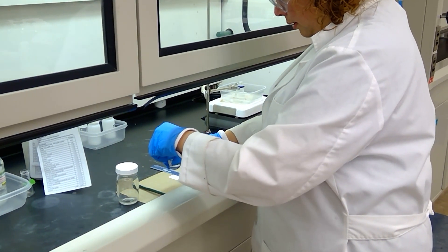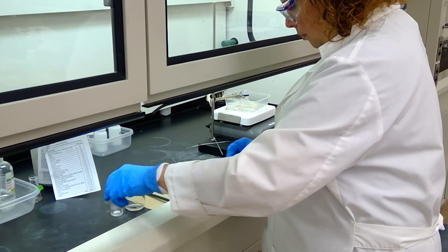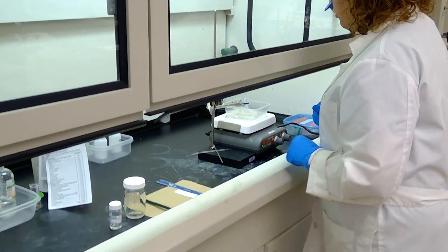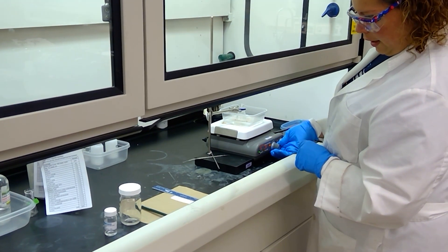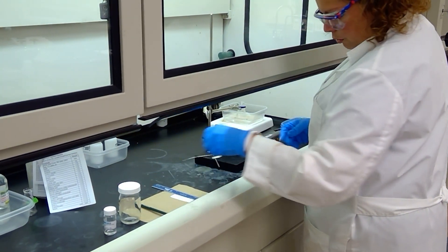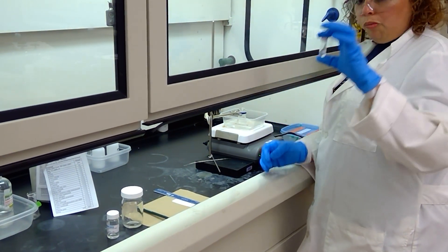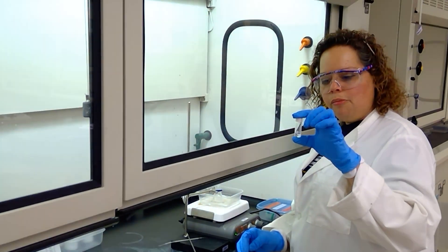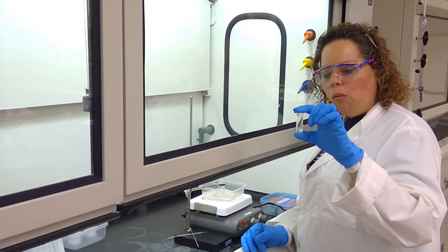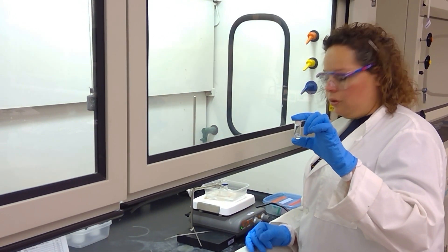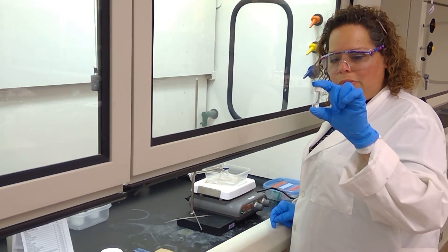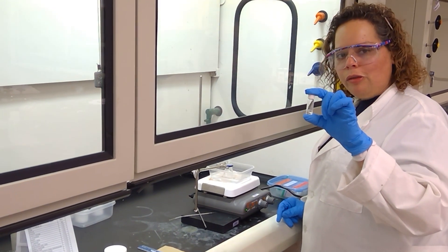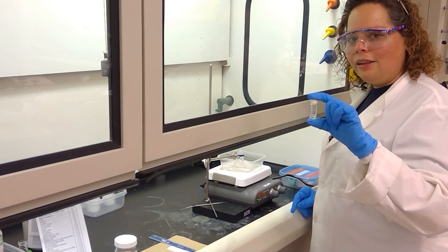I'm going to put a lid on my solution. And for the reaction mixture, I'm going to have to pause our stirring here and I'm going to take a few drops from the solution and place it into my small vial that contains a mixture of both ethyl acetate and water. The goal is to add a little bit of the compound from the solution and mix it up, and then we will be taking from the upper layer since the compounds we are interested in are in the organic layer.